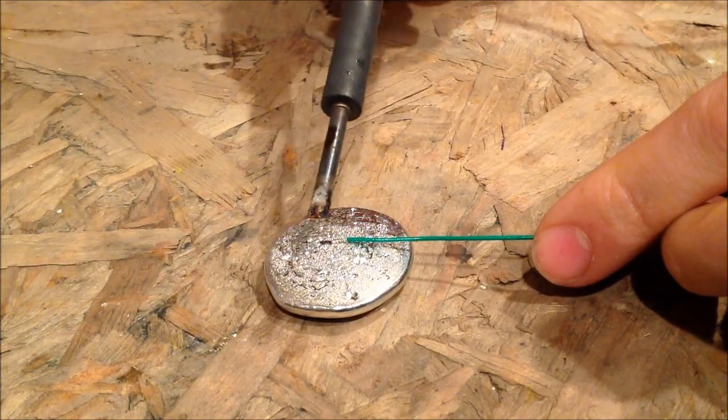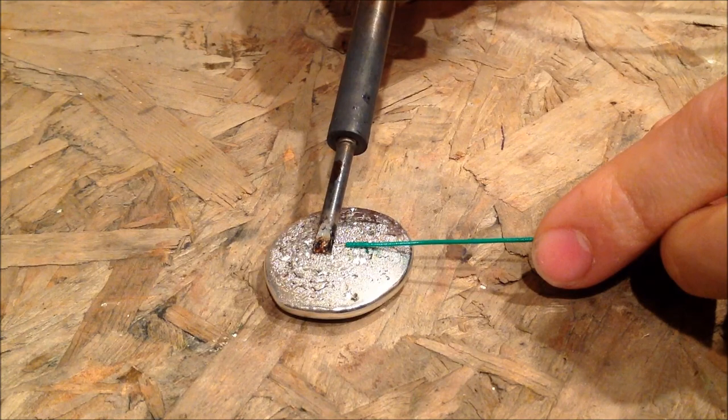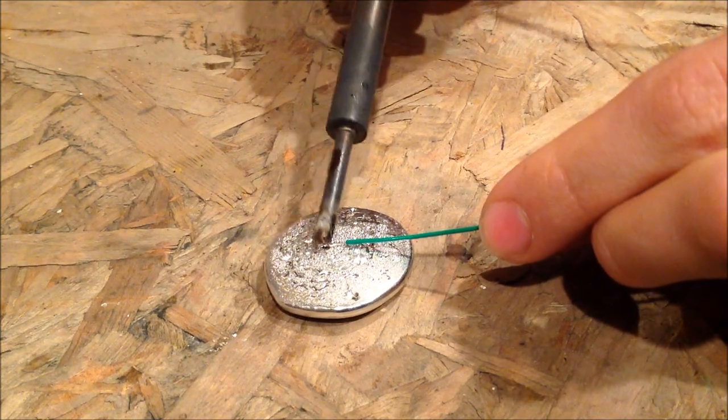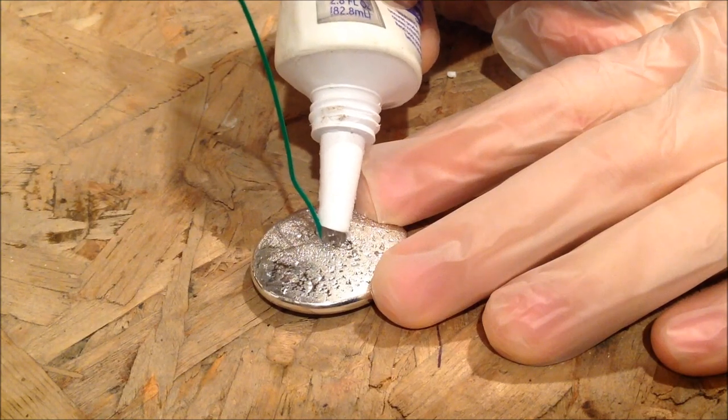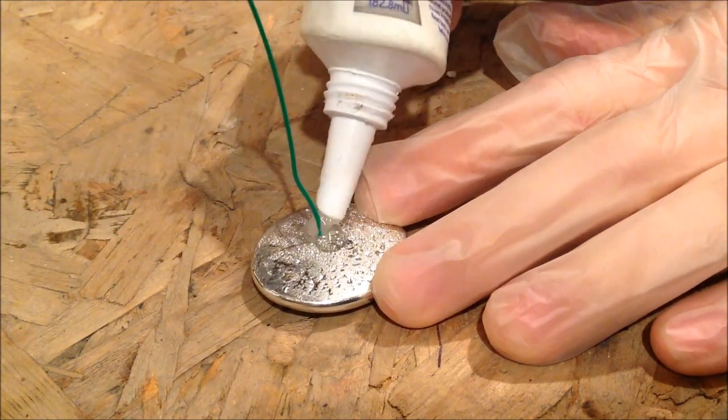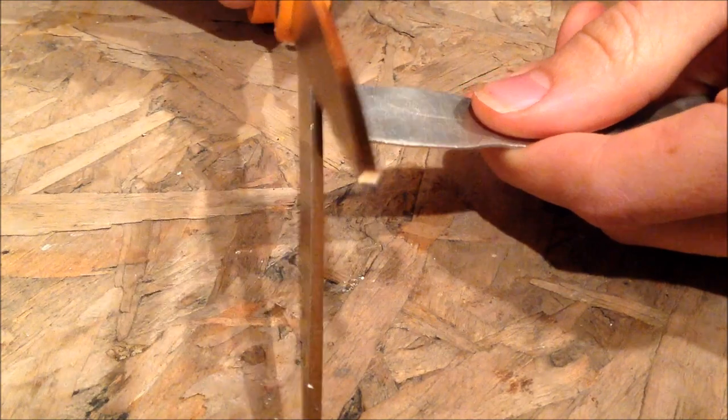I then soldered on a small wire as this is the anode that will be eaten up during the crystal growing process. I also sealed this anode with some caulk before proceeding to make a small tin cathode from a strip of tin.